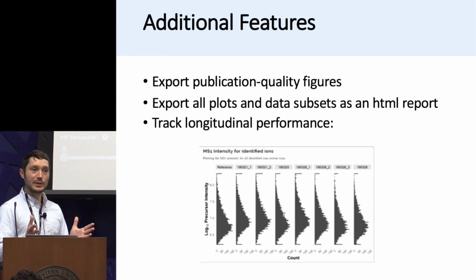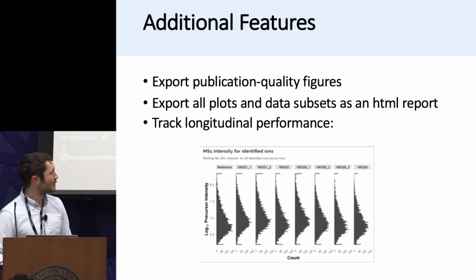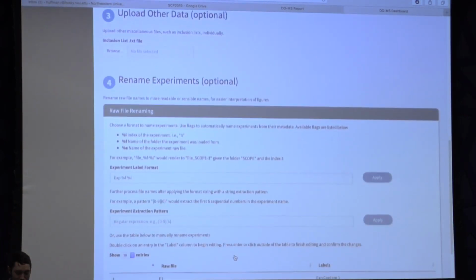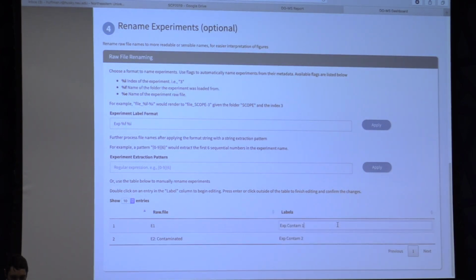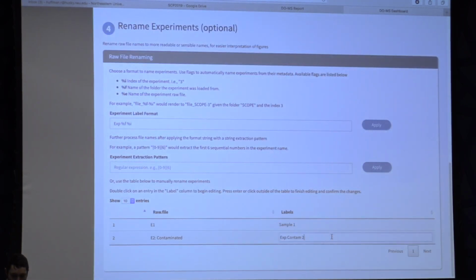All I'm doing is locating on my computer where the MaxQuant output files are. I'm going to hit confirm. It's going to remind me that I've actually already loaded this, so it's going to skip that. And then I can load the data. There's a little progress bar in the right-hand corner because some of these data files are quite large, all peptides, for instance, so it's good to know where you are in the loading procedure. And then we can come down to the bottom here and perhaps make some more informative labels for our samples.